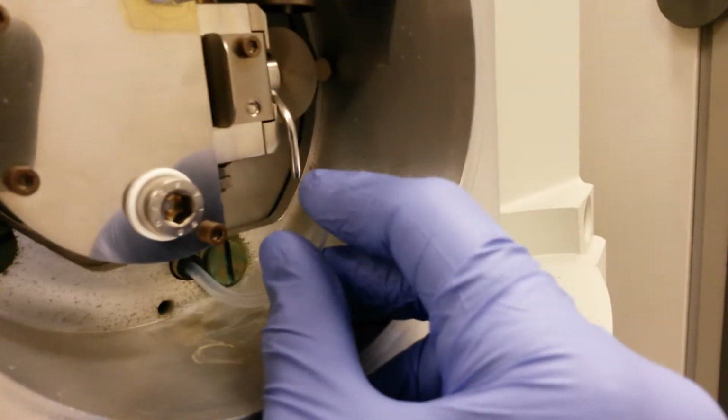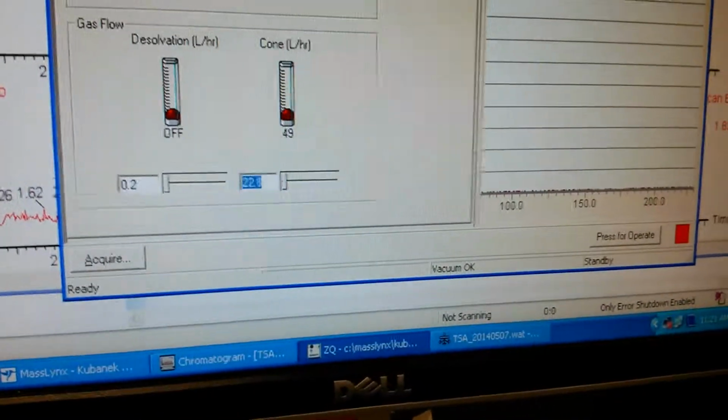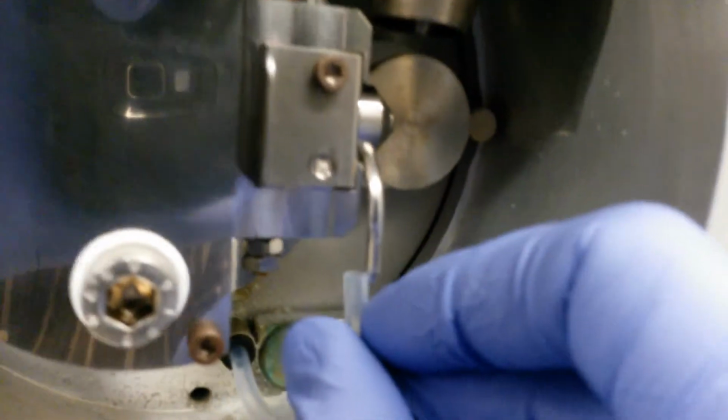But this is what it should be. If I turn that off, it turns off there as well. So I'll turn that all the way down, and we have no more flow from that tube.